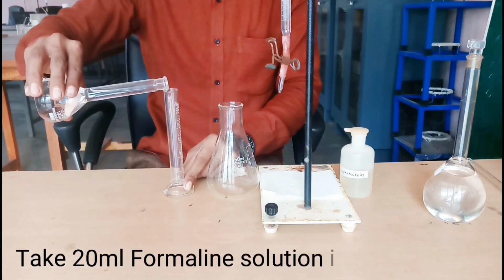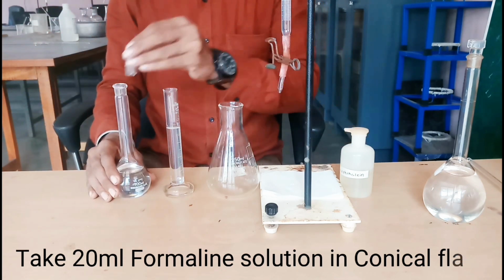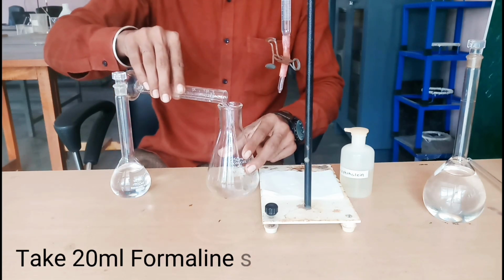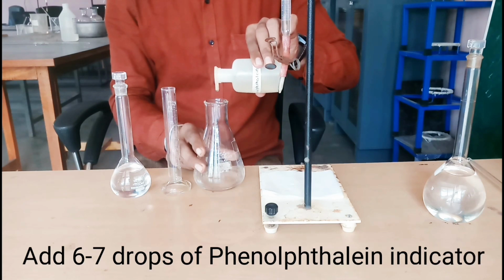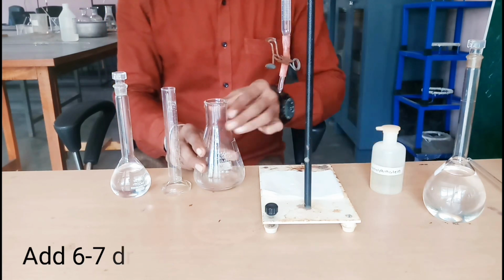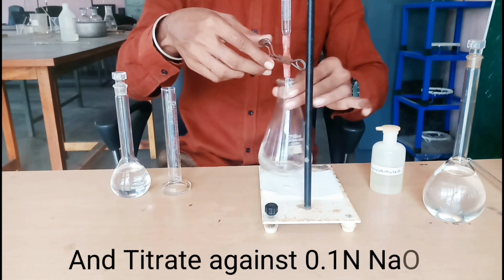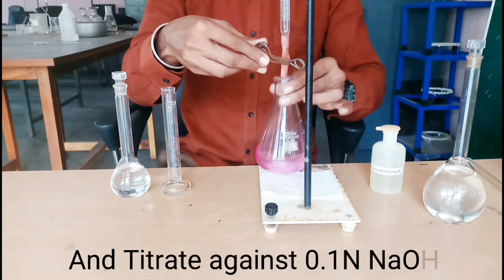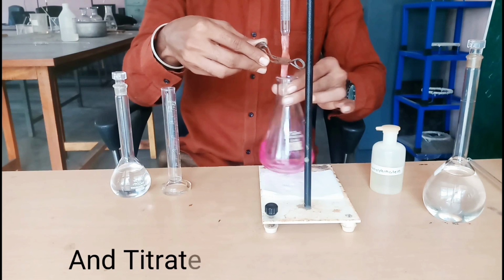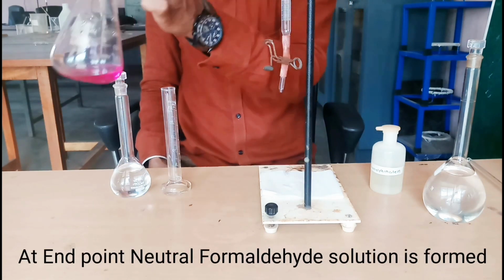Take 20 ml formalin solution in conical flask. Add few drops of phenolphthalein indicator. And titrate against 0.1 normal NaOH. At the end point, neutral formaldehyde solution is formed.